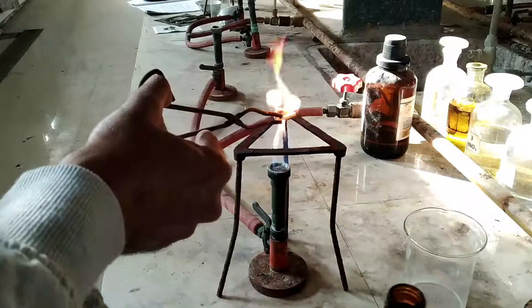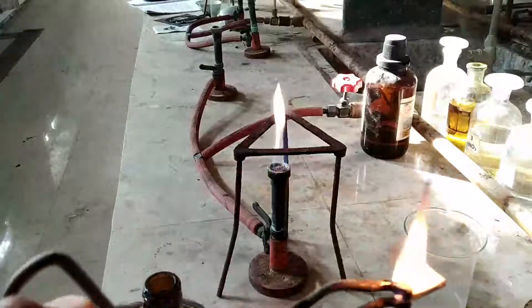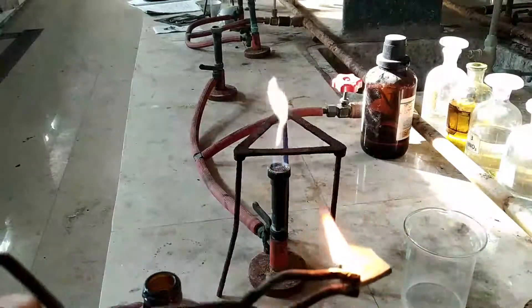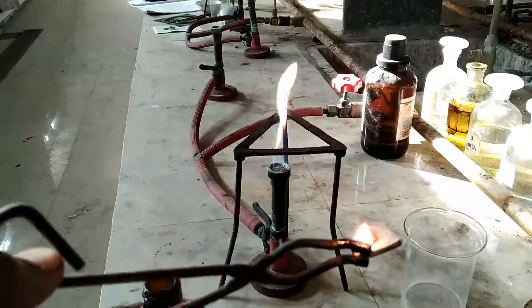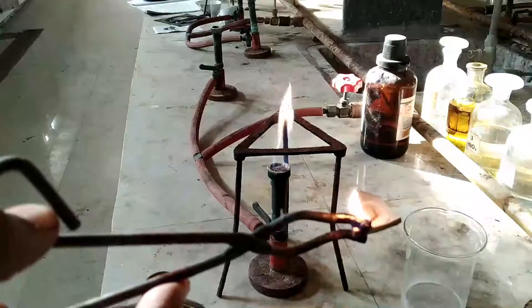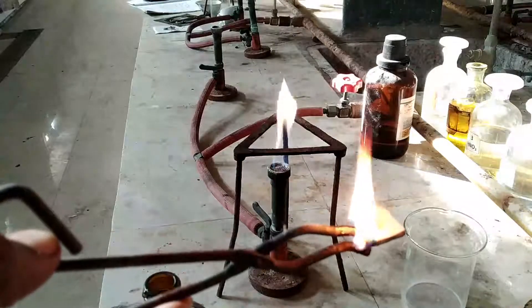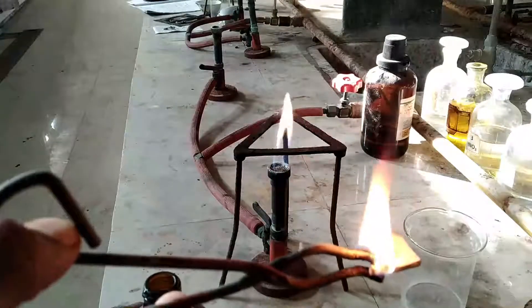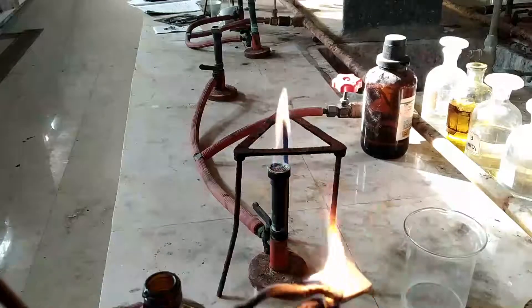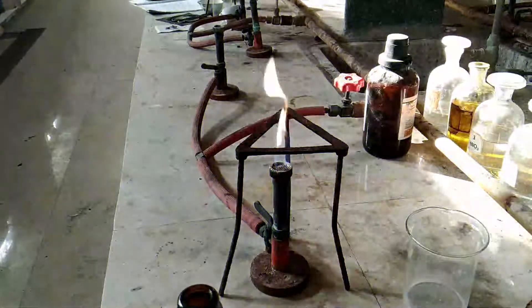If there is a sooty flame, then it indicates the presence of an aromatic substance. Here you can see a black soot coming out of the compound, indicating that the compound is aromatic in nature. Let us look at another example — this is also a liquid.